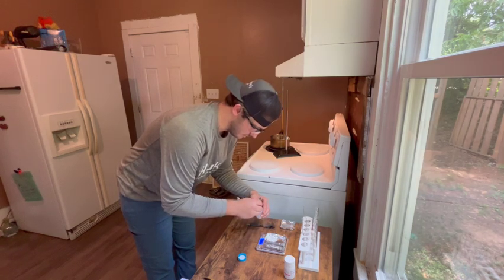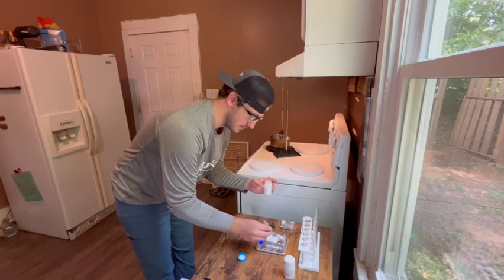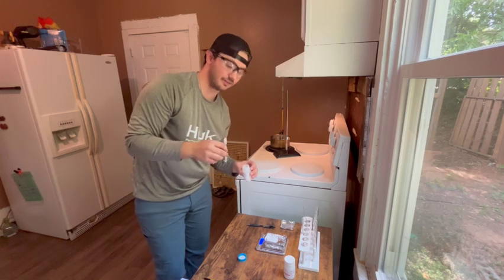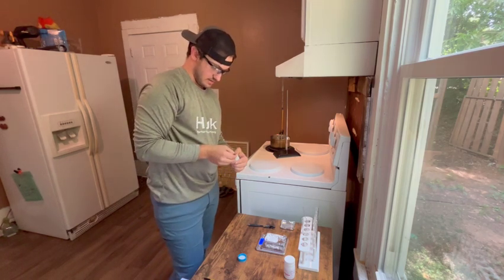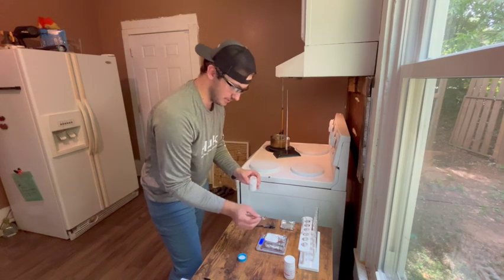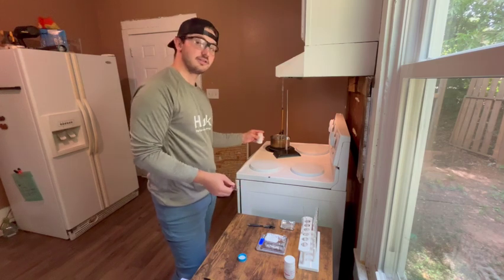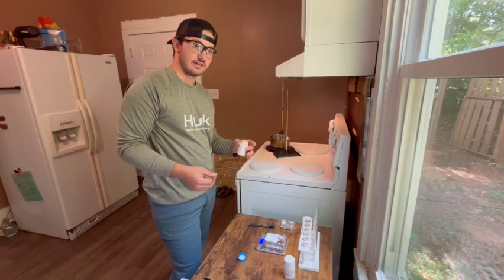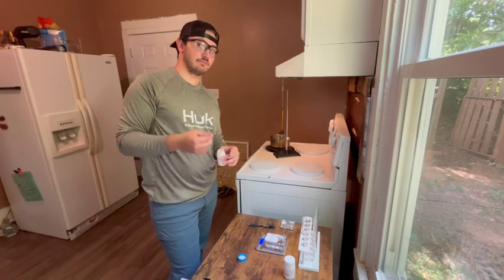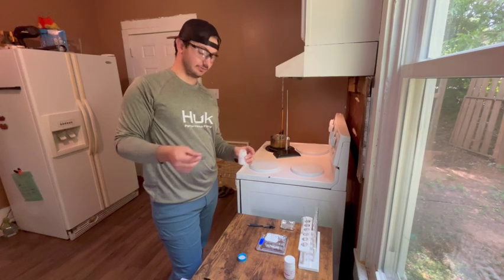So what I'm going to do is heat up my water over here to right around 50 degrees Celsius, and then submerge a test tube with the paradichlorobenzene into the hot water bath and time the amount of time that it takes to completely melt the amount of solvent that I have.